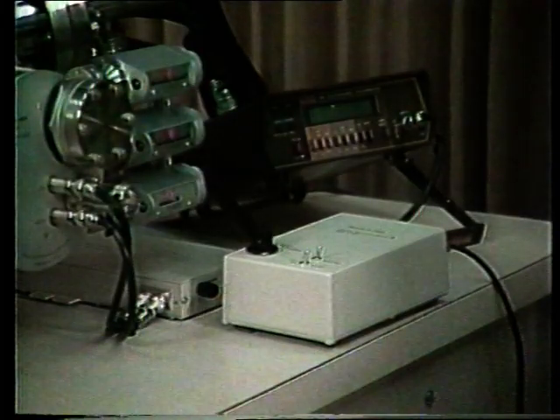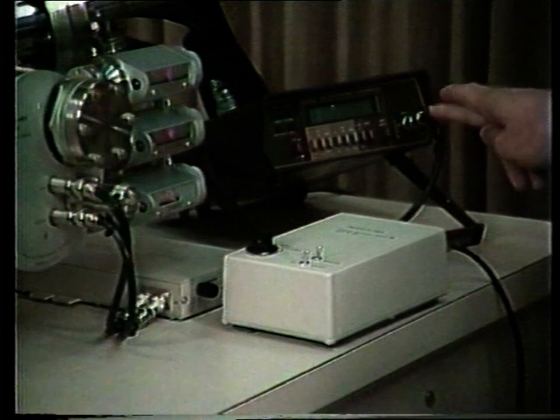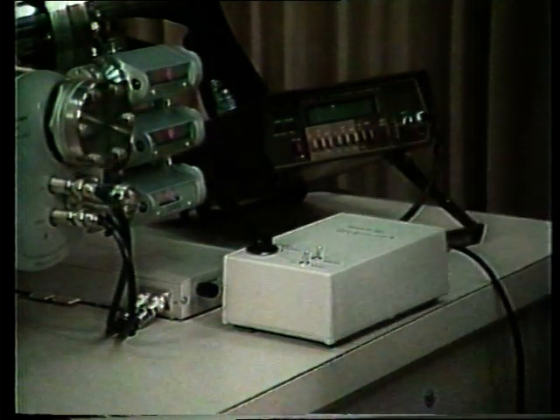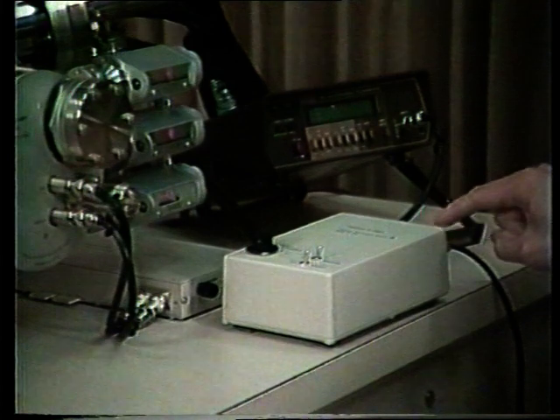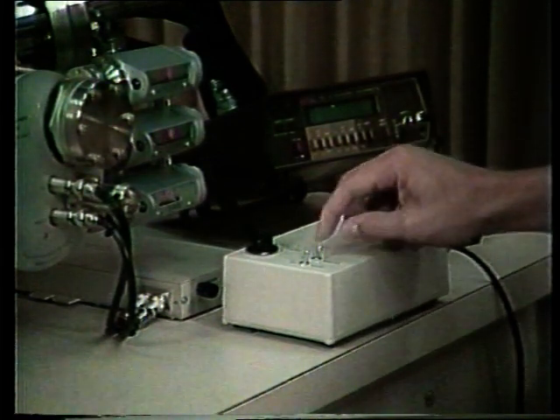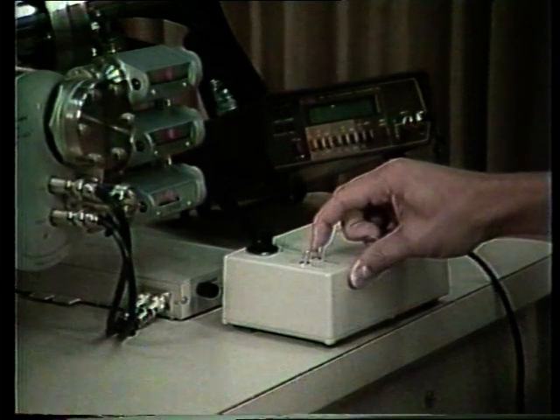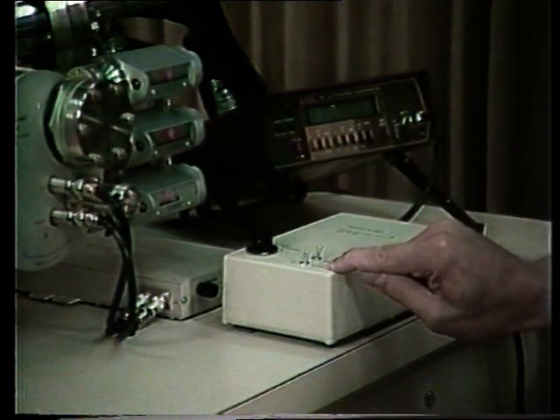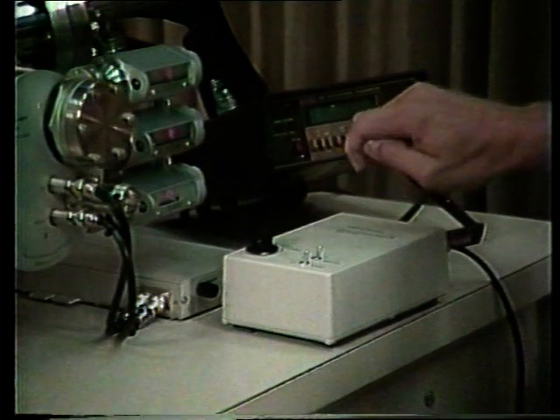ammeter. To connect the external ammeter to the target of the specimen stage, we first want to make sure that the input from the ammeter is connected to the BNC connector on the back of the bias box marked ammeter. Also on the back of the bias box there's a BNC connector marked target. We want a BNC cable connected there. We want our first toggle switch, which is labeled absorbed and ammeter, to be on ammeter, and our second toggle switch, which is labeled ion and target, to be switched to the target mode. We also want the black switch to be on plus 90 bias select.